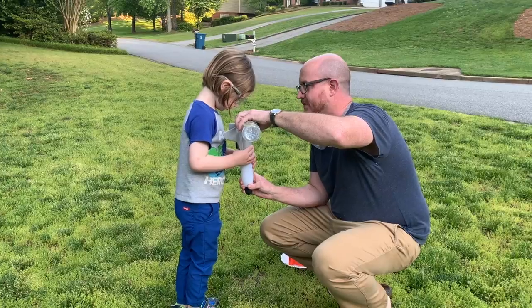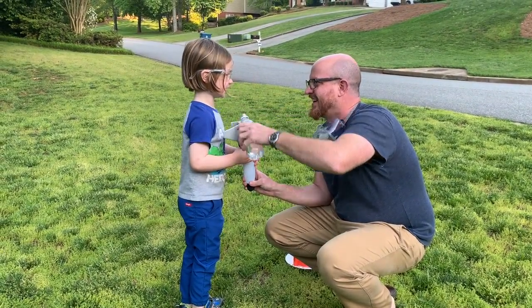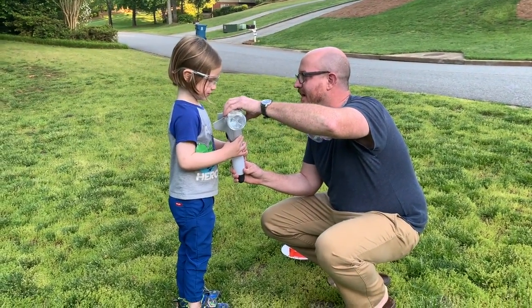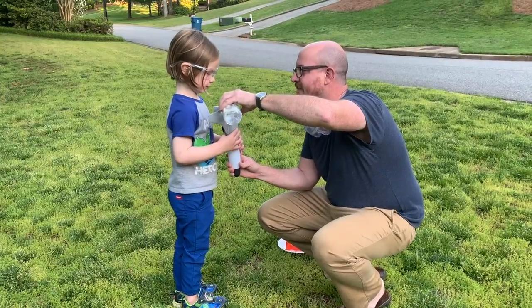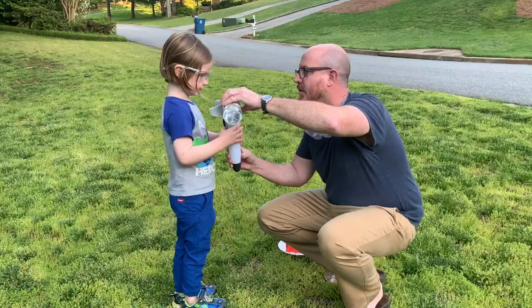What does that smell over there? Does that smell good? It smells like yucky cheese. Yucky cheese is right. Okay, we're at the minimum. Hold it steady for me. We're at the middle. Hold it steady.